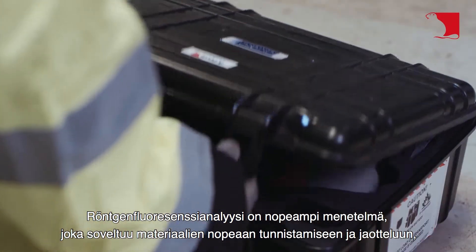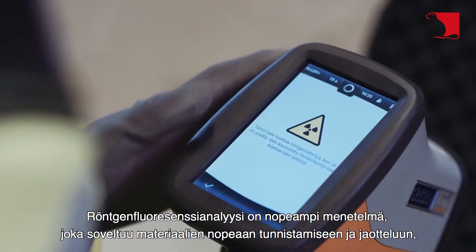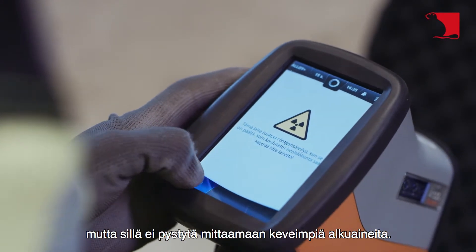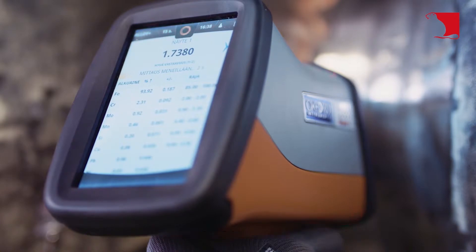X-ray fluorescence analysis is a faster method suitable for quick identification and division of materials, but it is not capable of measuring lighter elements.